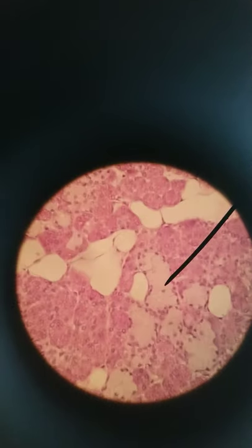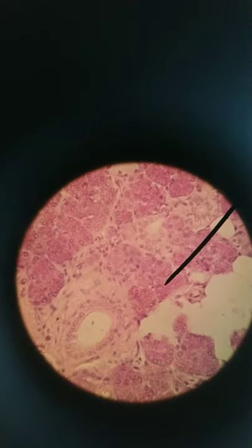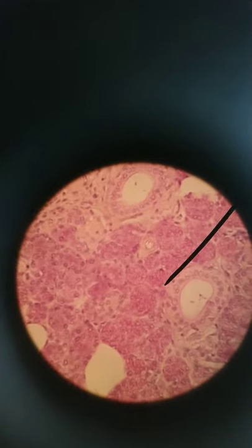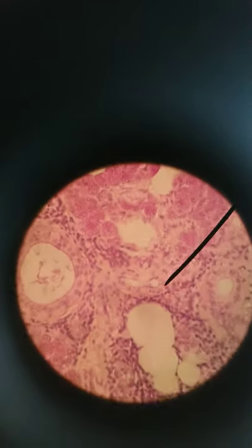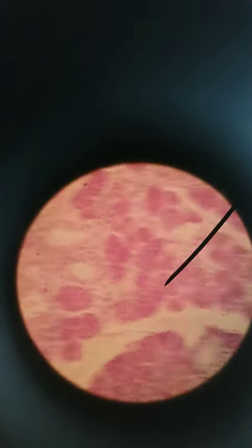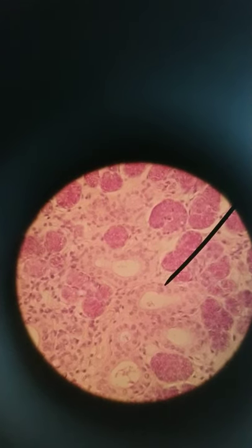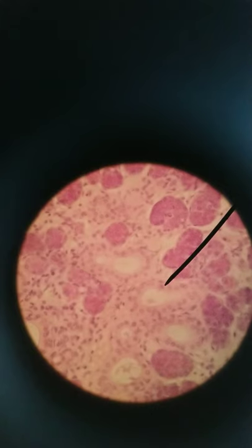Here's a good mucus one — mucus acini. The ducts are primarily simple cuboidal, sometimes simple columnar, and even stratified. But they're never squamous, and they're always these round clusters of cells. Serous acini are darker. You can see one layer of cells here and here's a second layer. Whenever cuboidal or columnar is stratified, it's usually only two or three layers — never more. We only see more layers than that for squamous.